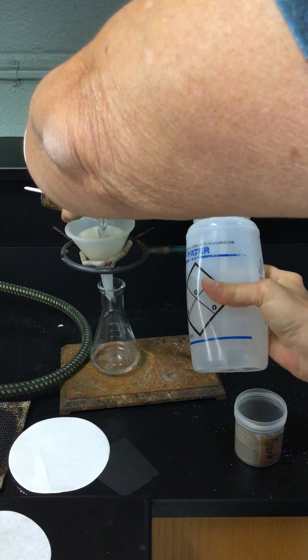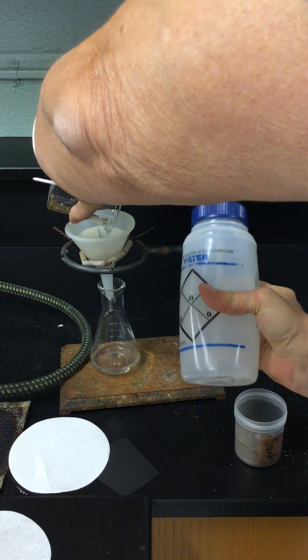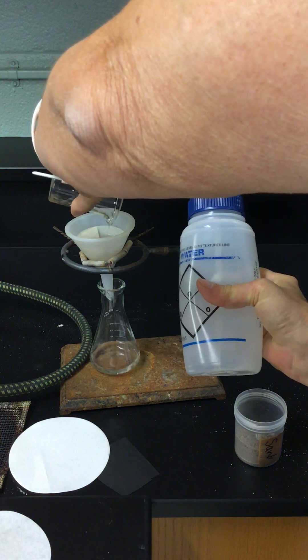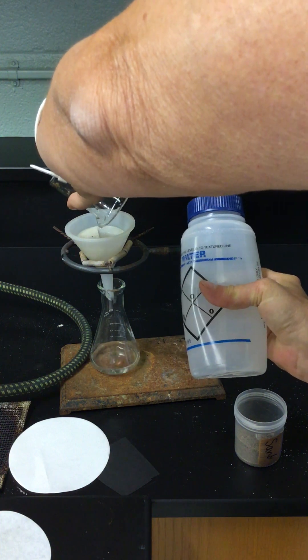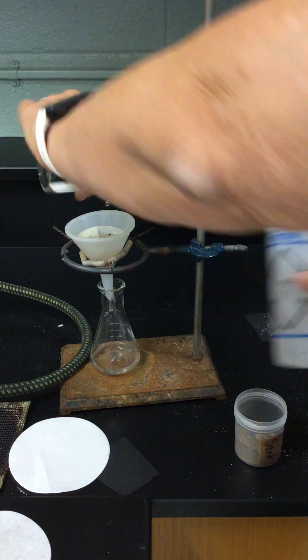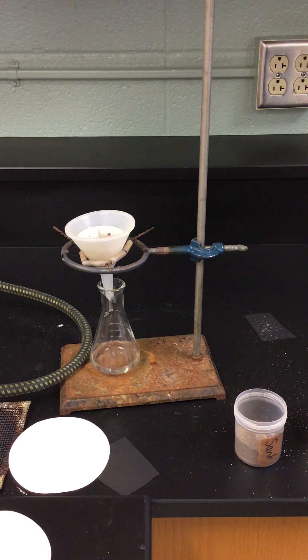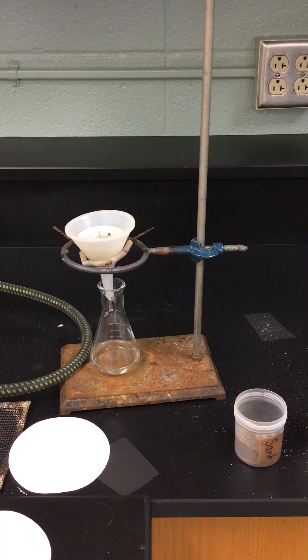I'll try to leave my camera open. I'm going to try to wash out much of my sand here. If you had to guess right now what's going to happen, you're probably going to guess that something will stay on the filter and something will go through the filter. Obviously the water that I'm adding is going through the filter.